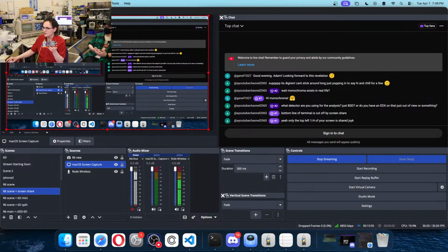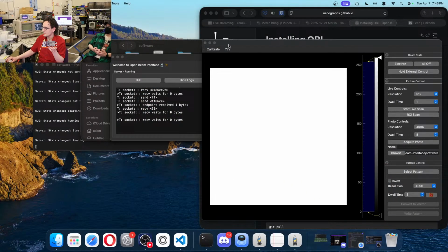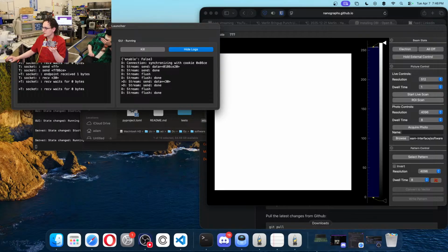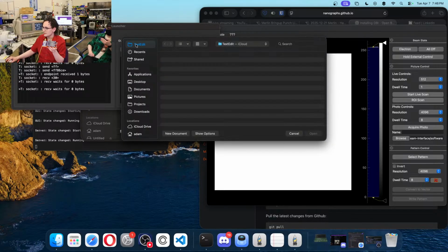Okay, so I'll just show you all just a little bit of what you might have missed. So there's our OpenBeam interface GUI. Here's our dialogues, and that's not what we wanted.